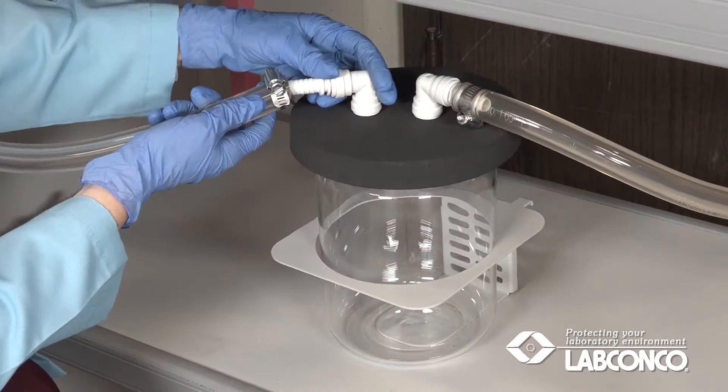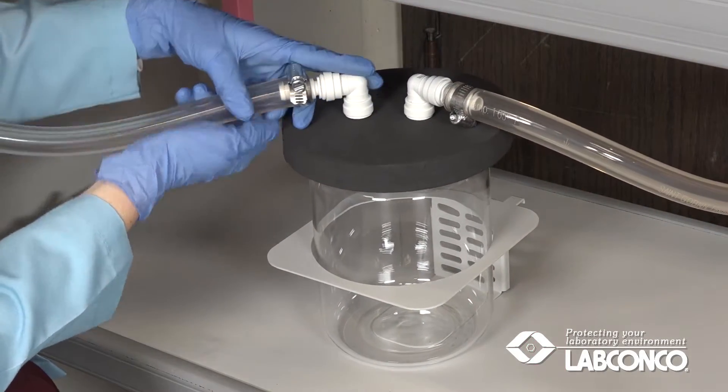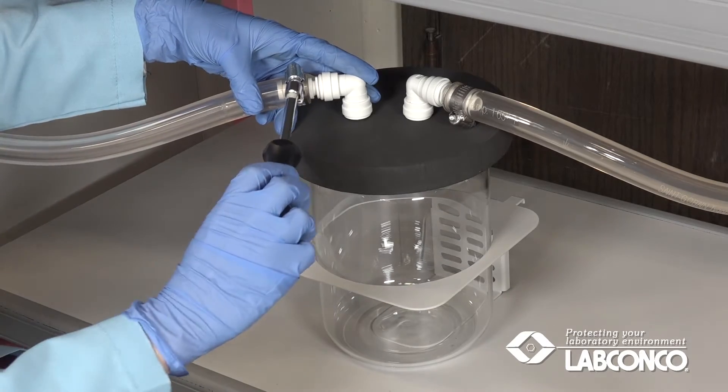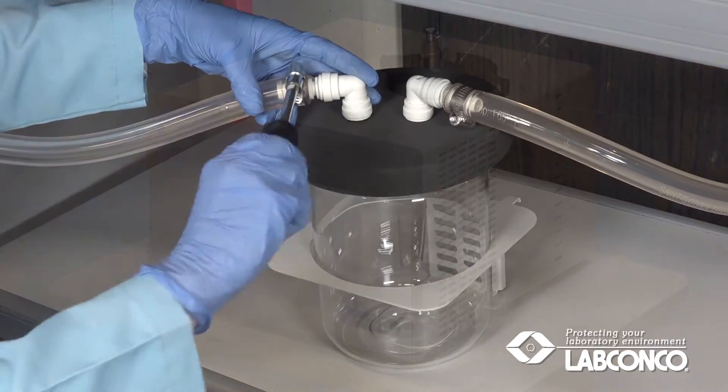It is also recommended to place a liquid trap between the RapidVap and pump to collect damaging condensation before it can enter the pump.